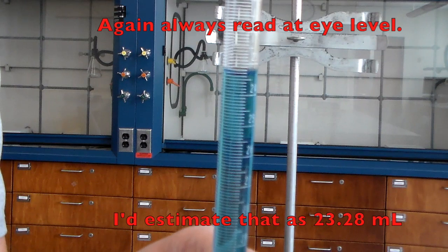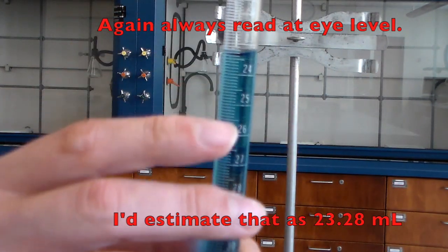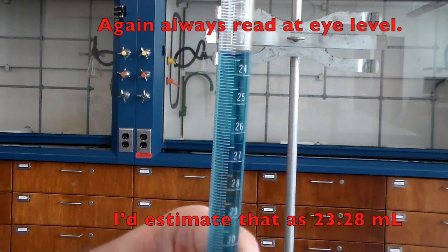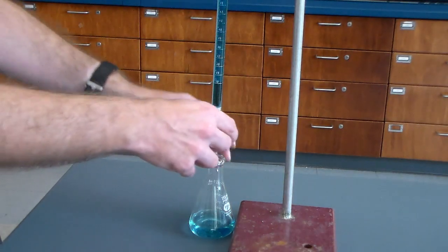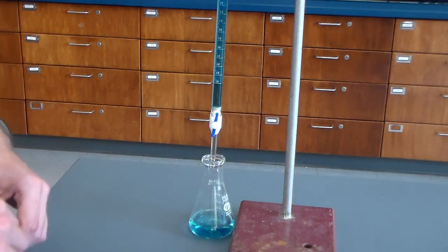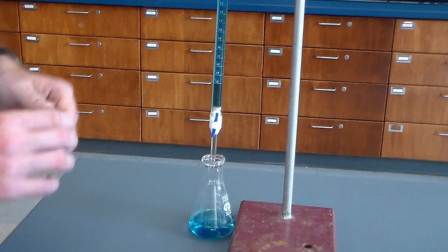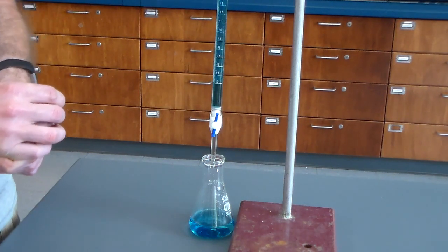And here again, we'd be reading our level to the 0.01 milliliter mark. So as you can see, there's my 24, there's my 23, which is up there. And again, we'd be reading this to the 0.01 milliliter mark. And then once you are done with this, you can just drain the rest of this into your waste container, and make sure that you clean it out in the same way that we started with, by rinsing with a little bit of water to get rid of any contamination, so it's nice and clean for the next person.